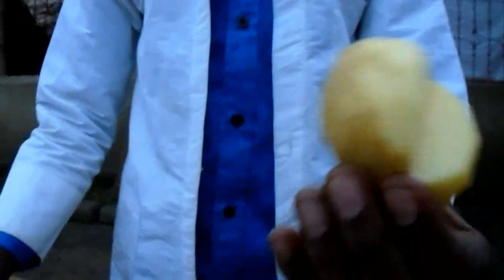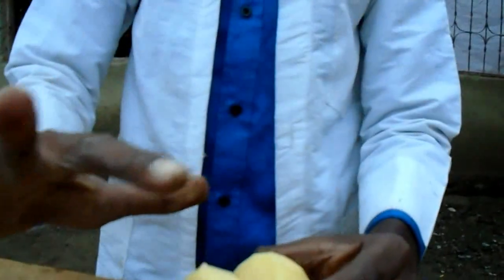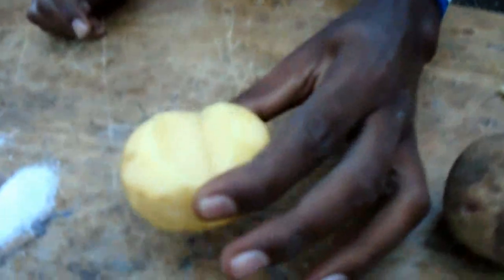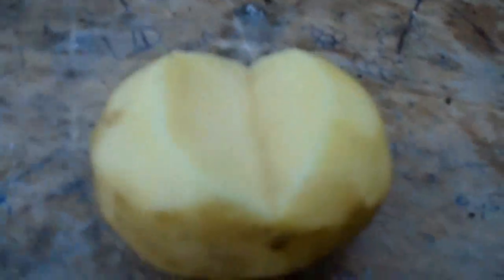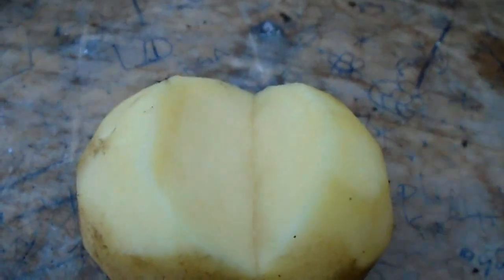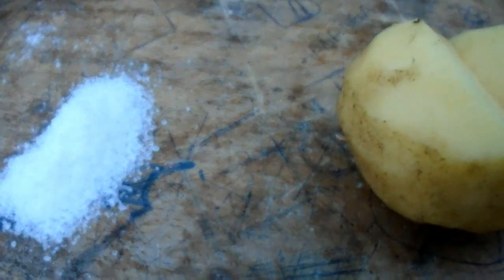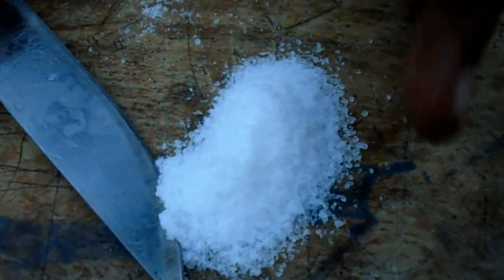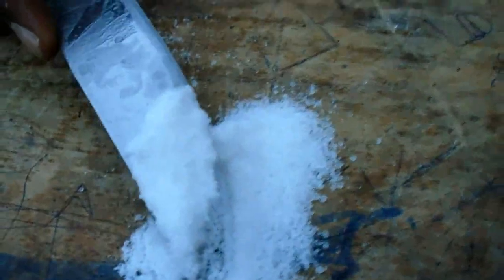This part has already been removed from the Irish potato and put aside. After that, I remain with the flesh — the flesh of the Irish potato. Now I have to put the solute concentration above this cut so that we shall see what will be going on. Placing it on the table, then taking solute concentration — I can take any amount. So I'm just taking some and using this instrument to put the solute concentration into the Irish potato like this.